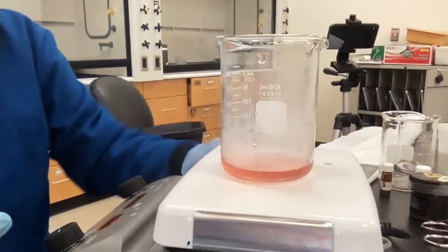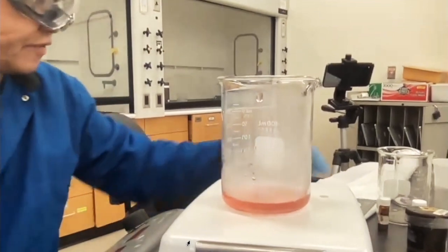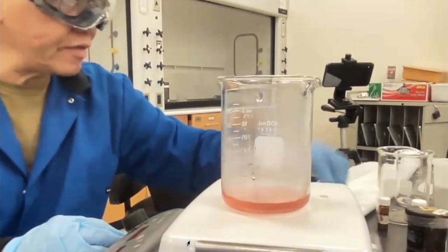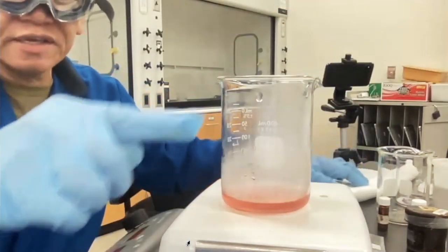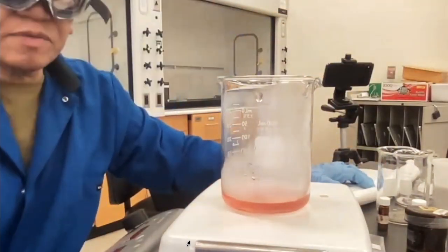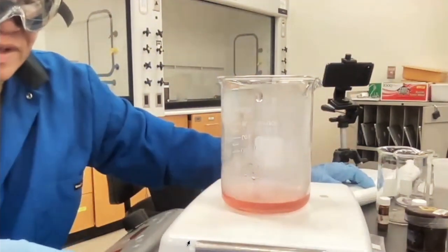And it's okay not to collect the water. You're going to see there's some steam that's coming off here. Let me see if I can't help you see that with the background. Maybe the white background's not good. Okay, but you can see the steam coming off, and then it'll leave the chemical behind.